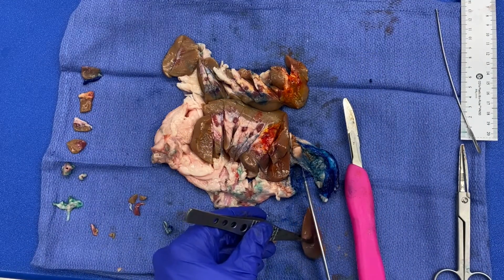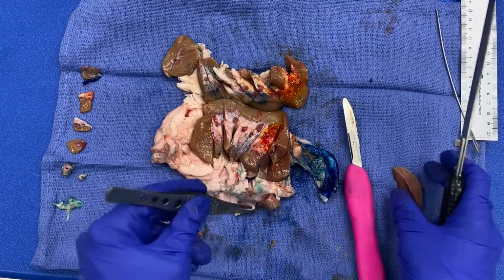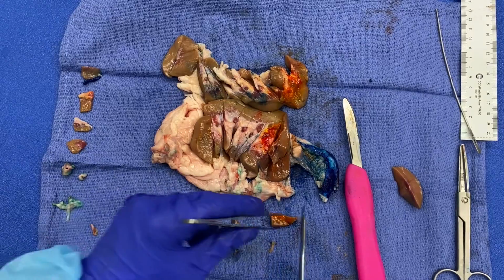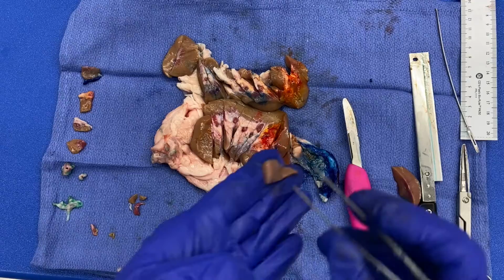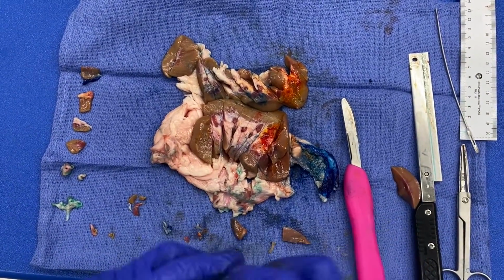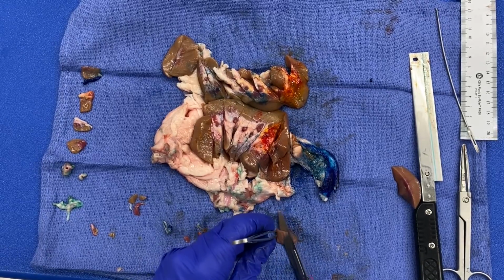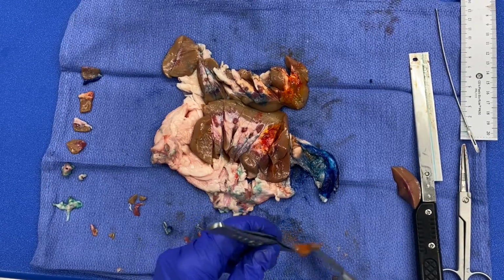cut like this. Change my plane a little bit. And now I've got my tumor with its closest approach to the capsule. Check our size here, a little thick, see? Hopefully you can appreciate, a little thick on that side. So what I'm going to do is trim. You want to trim on the opposite side from what you're going to submit into the cassette. So you don't want to trim the tumor away, right? You want to keep your relationships.